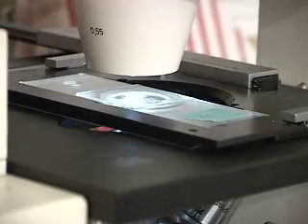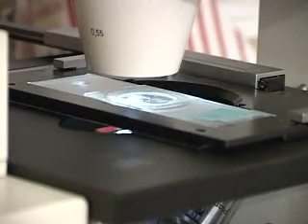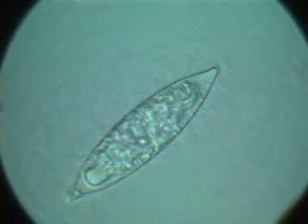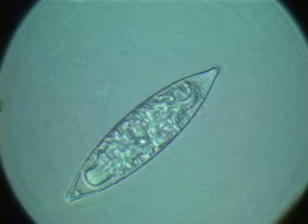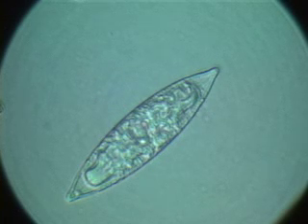These samples have been stored for a while, and quite a lot of degradation is still occurring — you can see a big difference compared to freshly fixed samples or to live material. Here you see a different kind of diatom species, and you can see that it looks distinctly different from the other two species we have seen before.